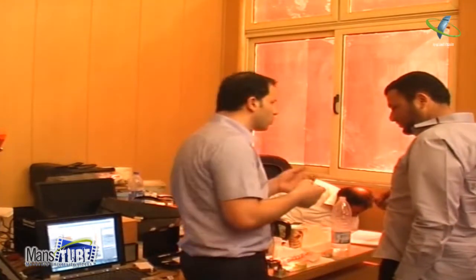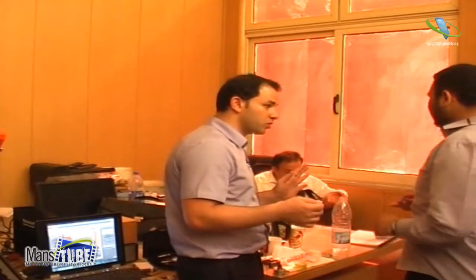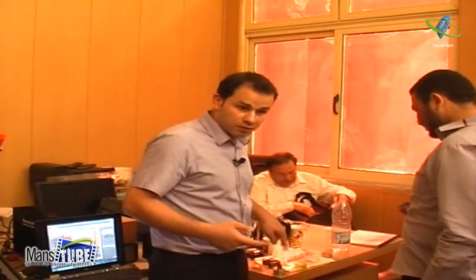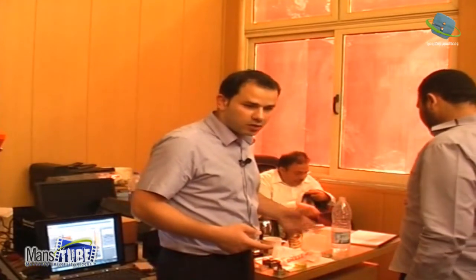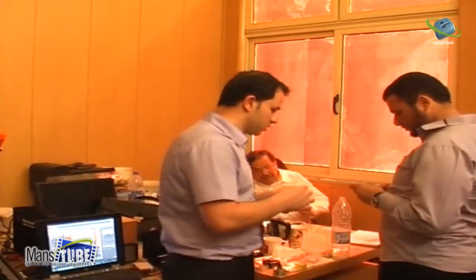You can also work not just in water. For example, if you have acid or basic solutions, you can work in them. But after that, you have to clean this. When you finish measuring, you immediately clean it with water or something else, and dry it. Okay?